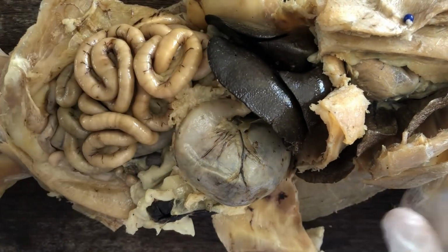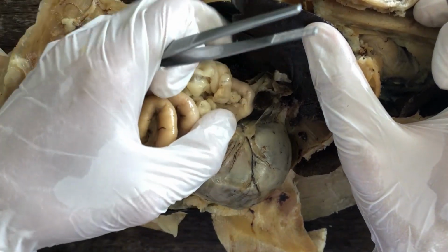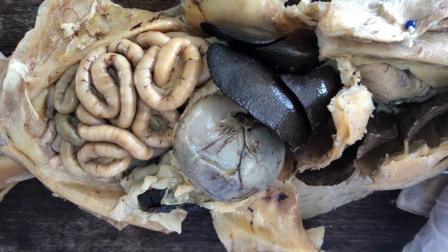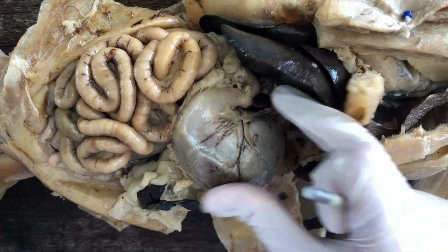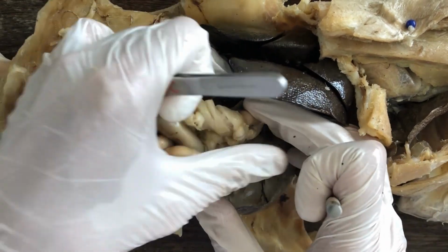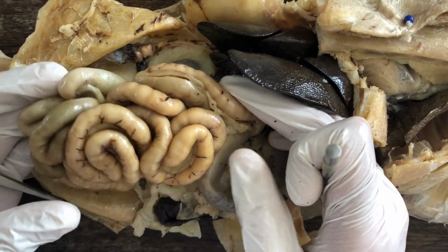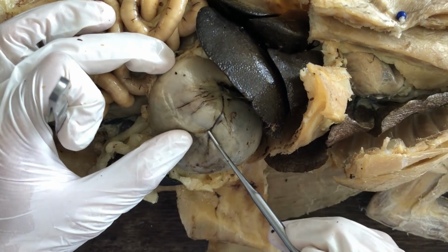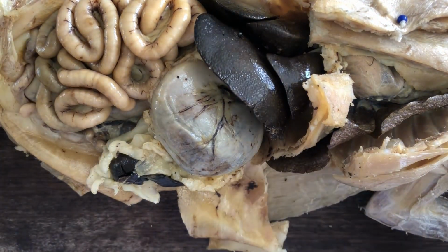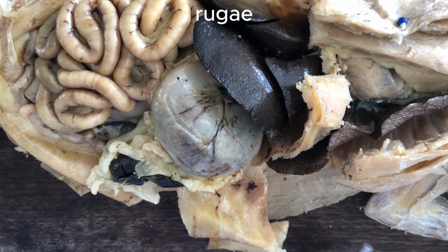Okay, and the main function of the stomach is for digestion, of course, but specifically for protein digestion. So this is the site where the food will be stored and mixed with gastric acid and also an enzyme called pepsin, which will initially digest the proteins contained in the food, and it will essentially transform the food into an acidic mush called chyme before that chyme enters the small intestine for further digestion and finally nutrient absorption. If you make an incision, which you should do, to see the mucosal wall of the stomach, you'll see that it will contain longitudinal folds called rugae, which allows the stomach to expand.